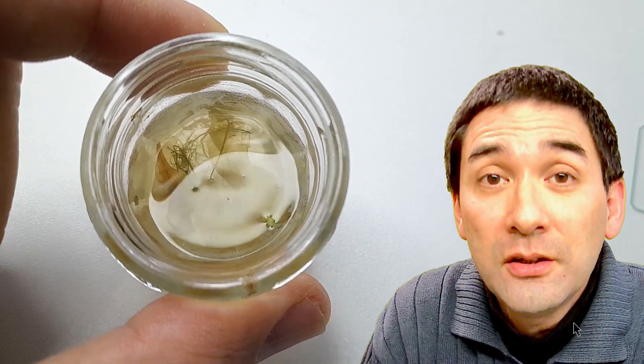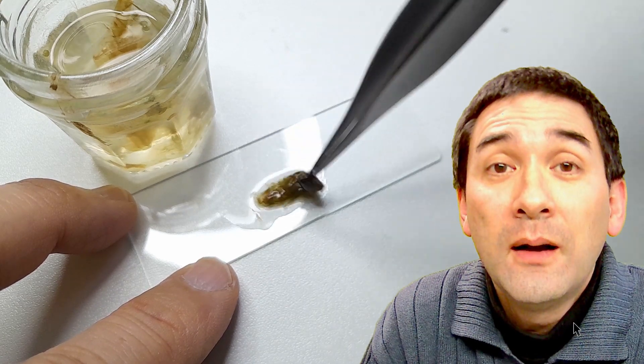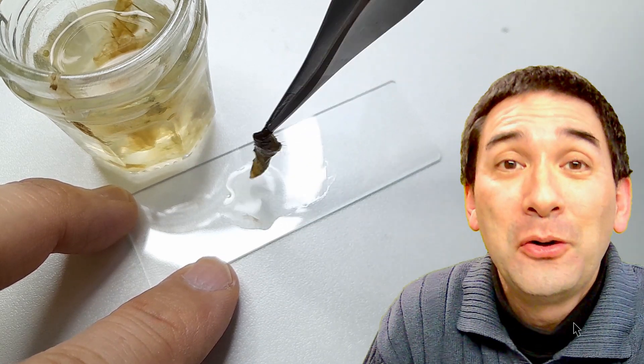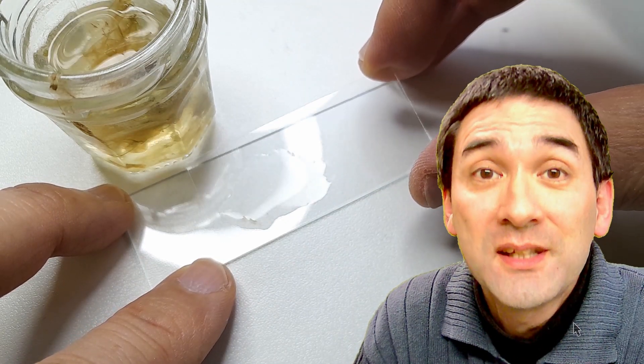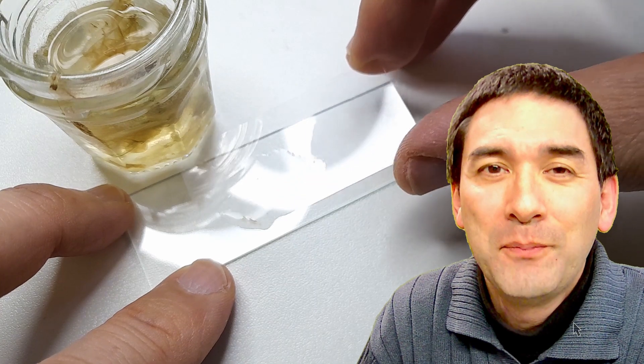This is food for bacteria and the bacteria will then start to grow. After one week you will not only find bacteria in there, but also a large amount of other water microorganisms, protists for example. I'm going to show them to you in just a second.